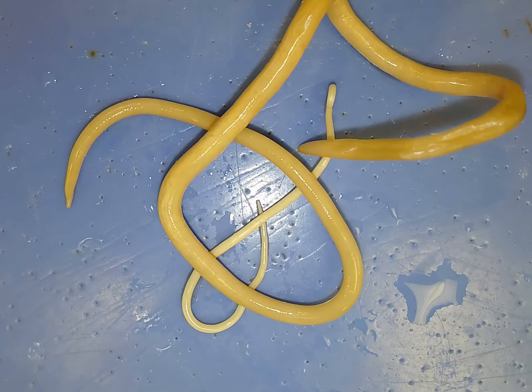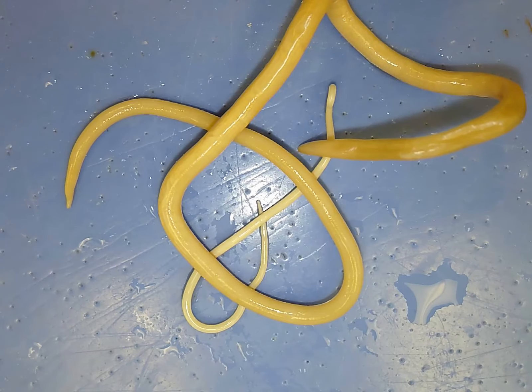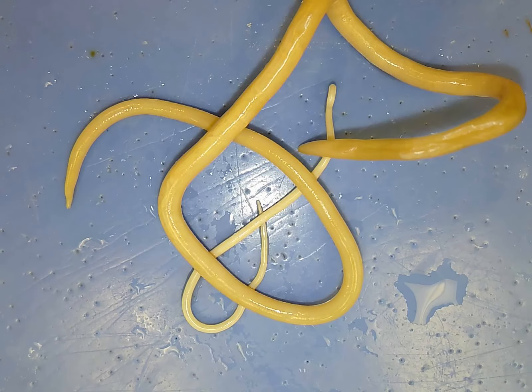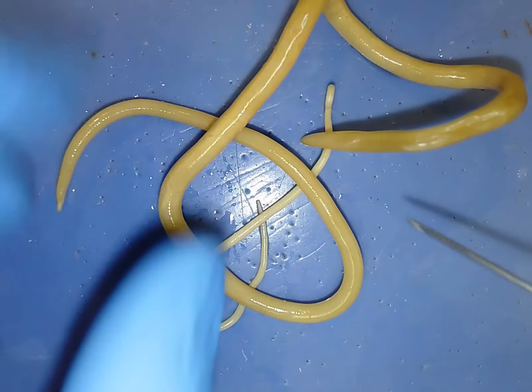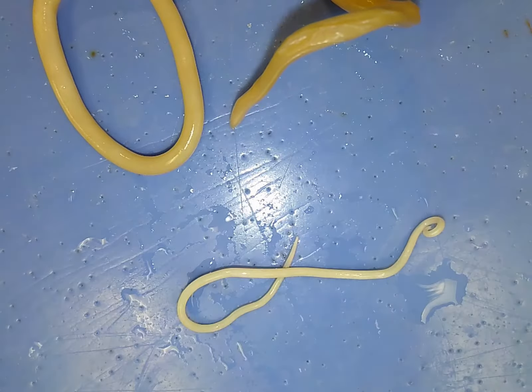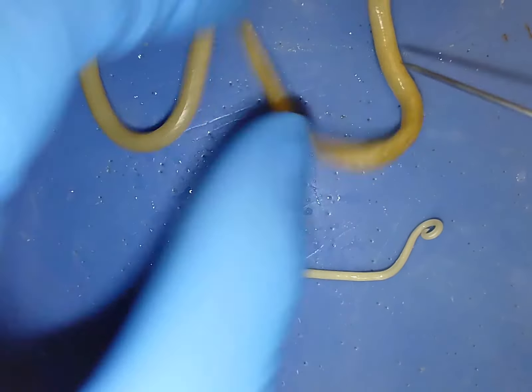Here I have representatives of the phylum Nematoda — these are the roundworms. More specifically, these are Ascaris lumbricoides, or the human roundworm. This organism infects both pigs and humans and is a pretty nasty parasite to have.